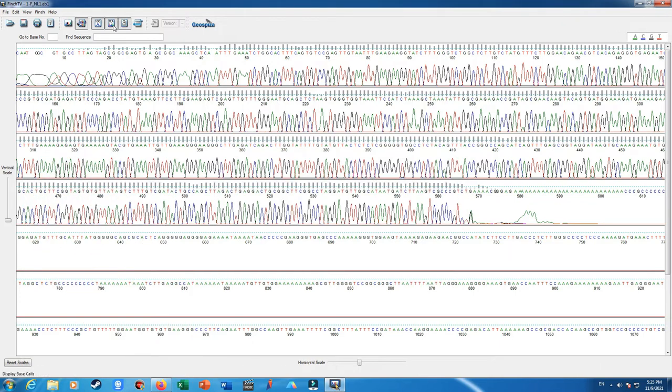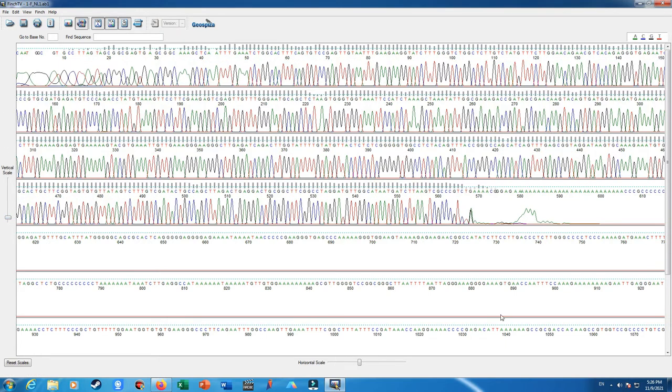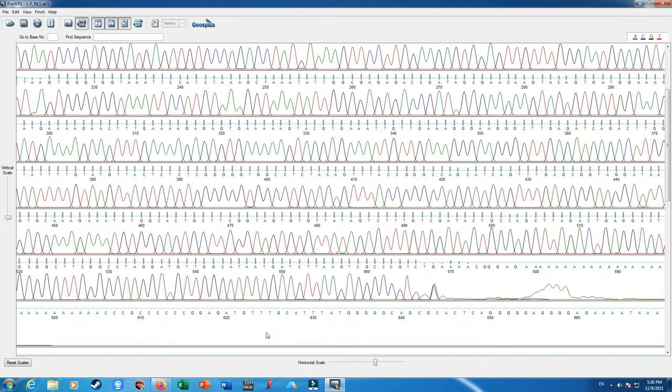I have the quality of our sequencing shown here by Q, and it's also defined here in the scale bar. Almost similar to the Phred scores in next generation sequencing, here we also have quality values. Let me first adjust the viewing of our data. I am going to use the wrapped view and change the horizontal scale to see the peaks well separated and distributed in the view.